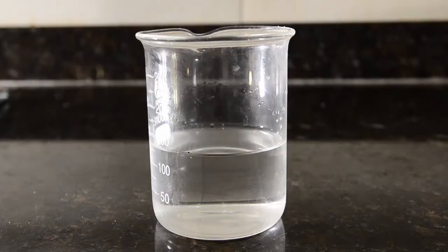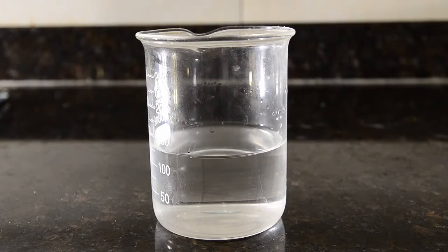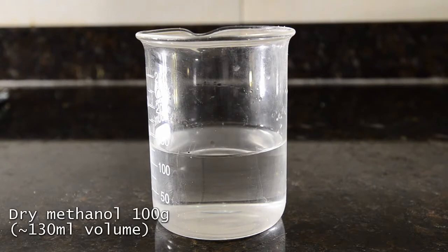The other key ingredient we need to use is methanol. Ethanol can also be used. We're using 20% of the weight of the oil, which is 100 grams of methanol. As you can see this is around 130 ml.